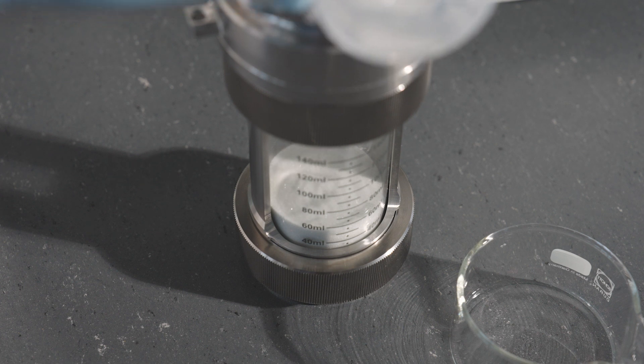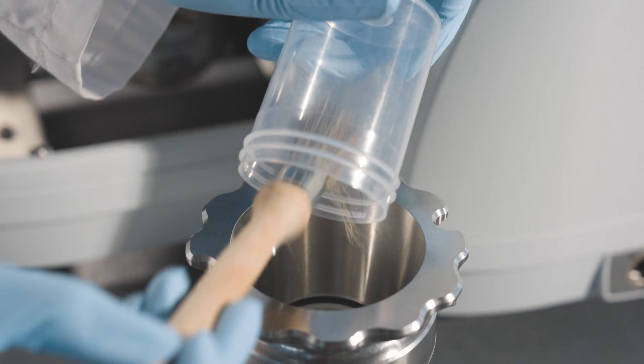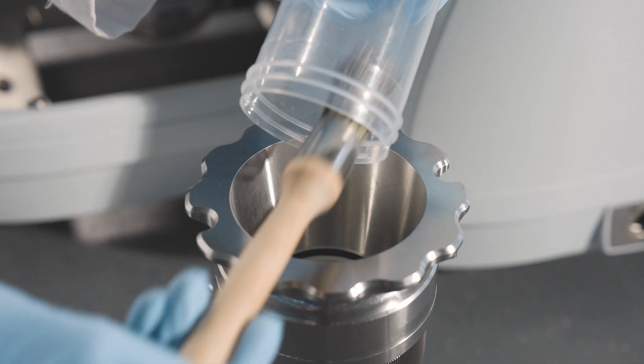For samples smaller than the reference sample, more than one sample body must be used to ensure high measurement accuracy. Avoid measuring errors caused by incorrect placement of the sample.